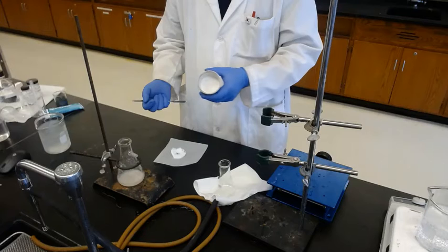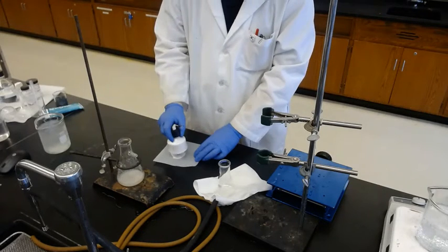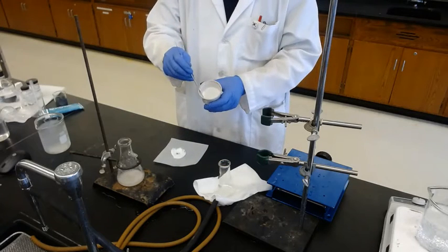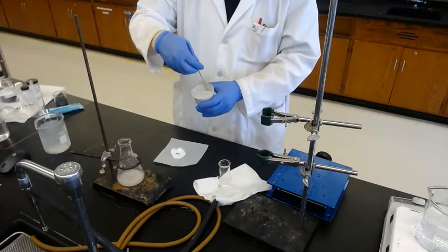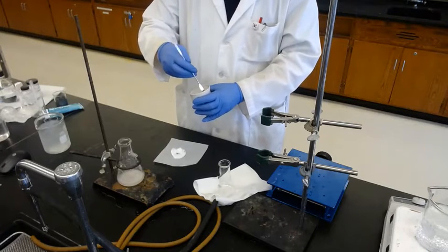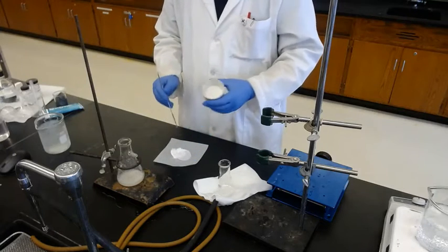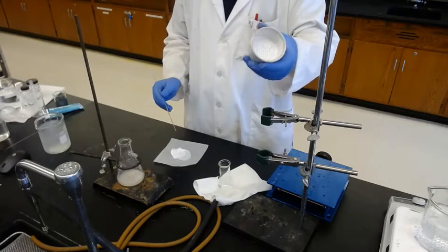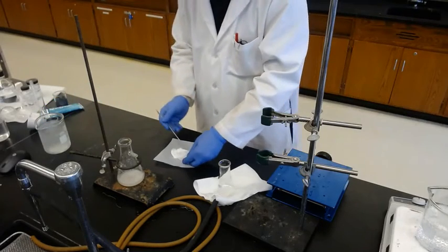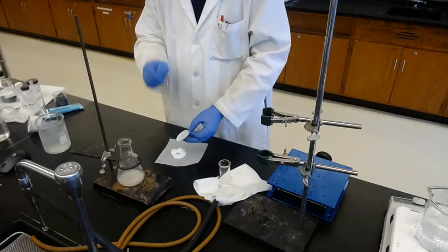Yeah, most of it is out. If it's still remaining there and not coming out after tapping, then you scratch just outside. The purpose is to take the whole paper out like this, so nothing is there. Okay, it's clean. Then you're holding it, just scratch using the side of the spatula.